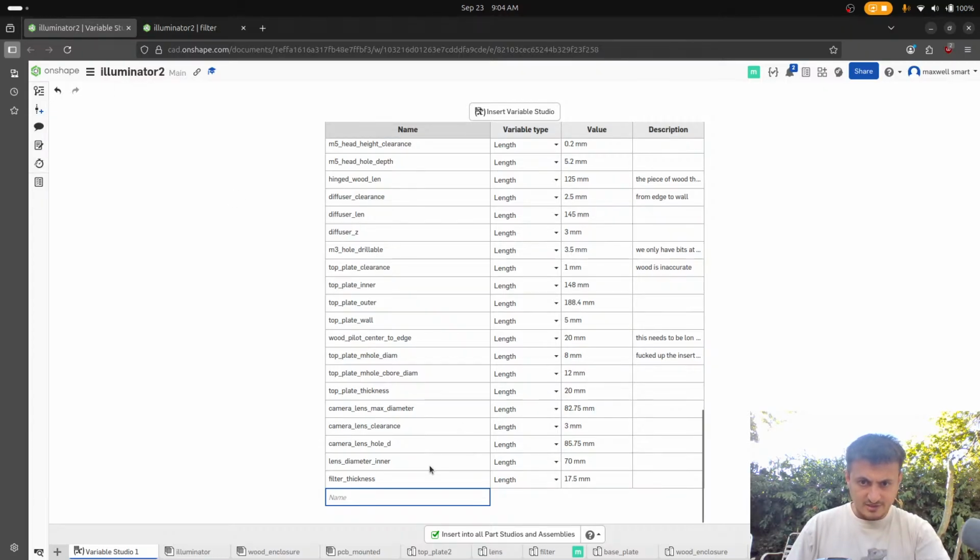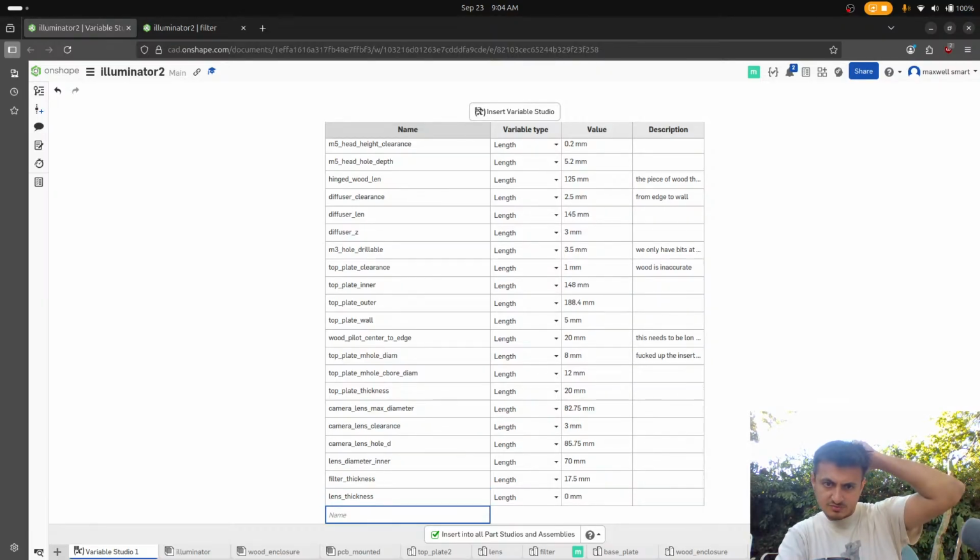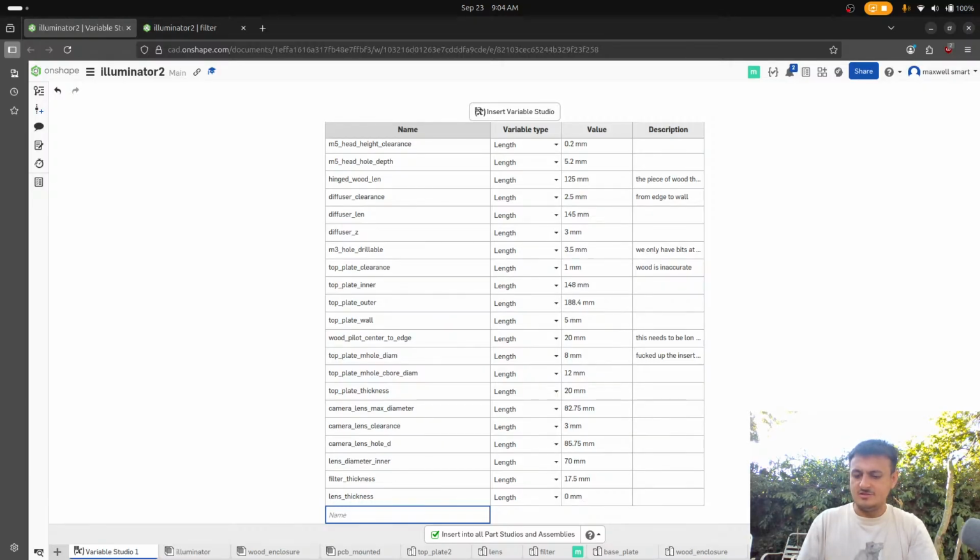Lens diameter inner. Lens thickness. For these radial parts, we're just going to call it thickness and diameter. Those are going to be the names for cylinders. I'm sure I've called them many other things in the past.